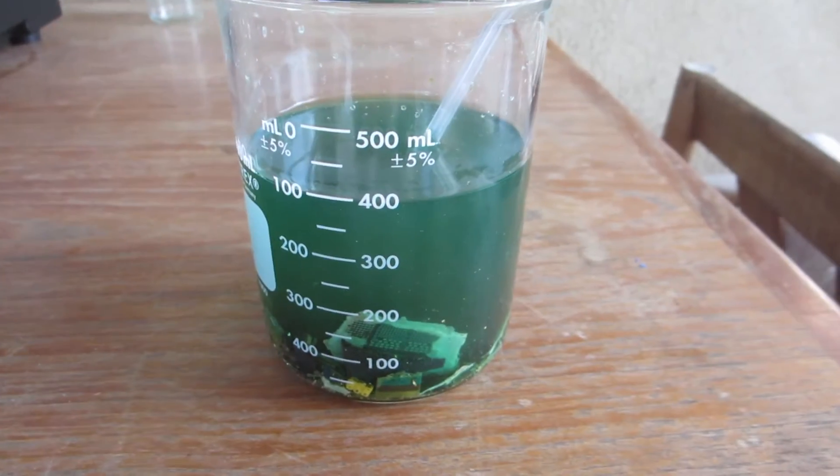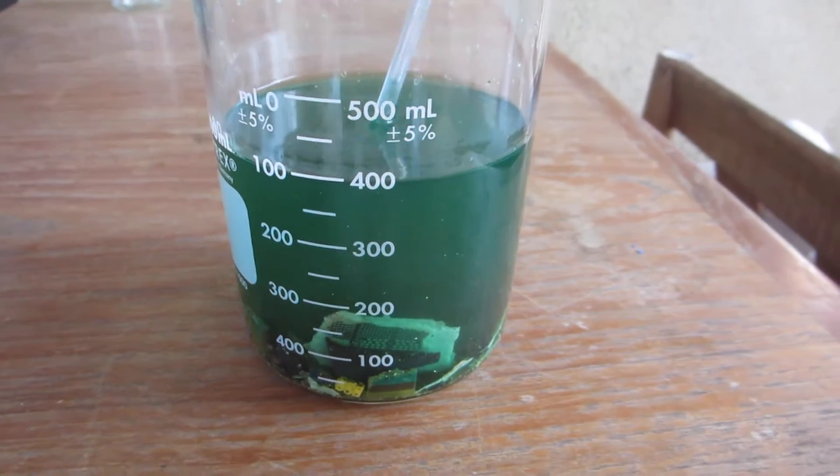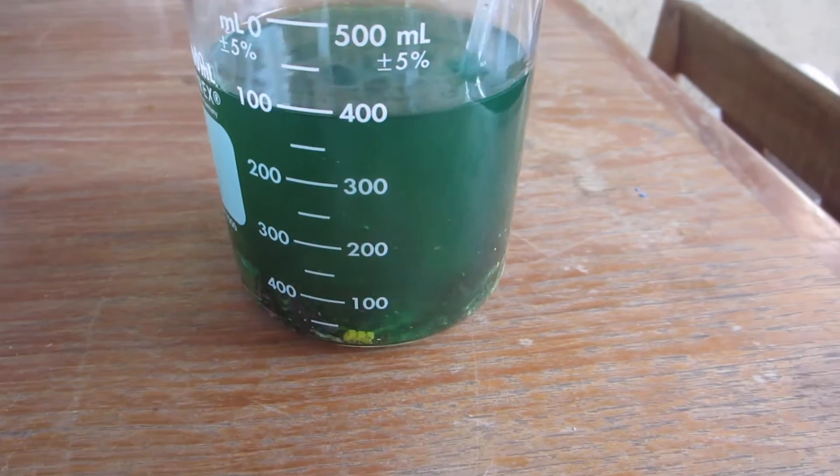After a few hours, I transferred the solution to a larger beaker and added more hydrogen peroxide and hydrochloric acid.